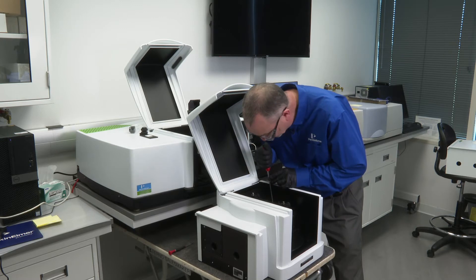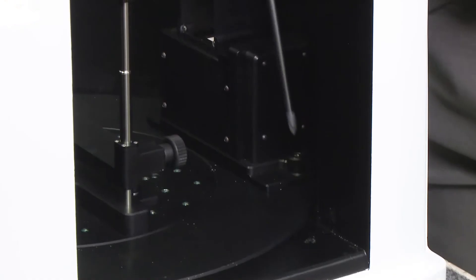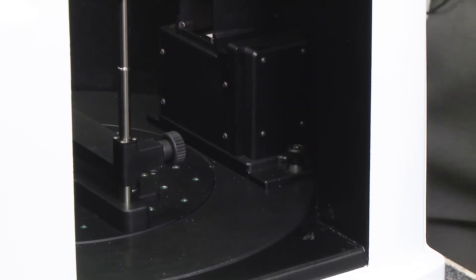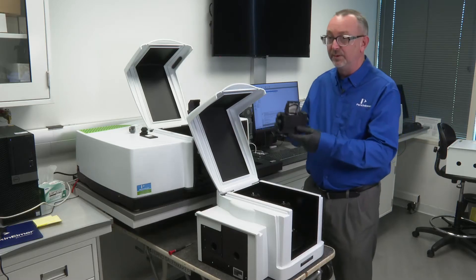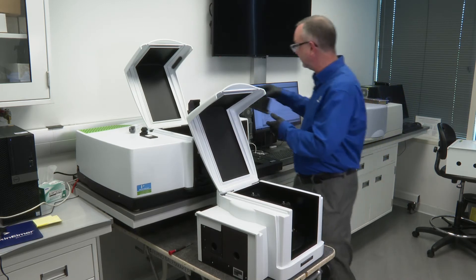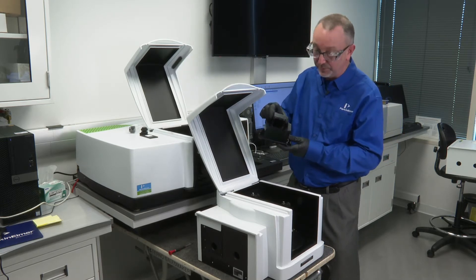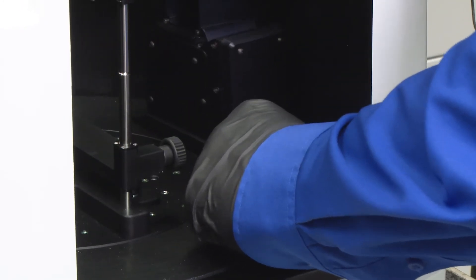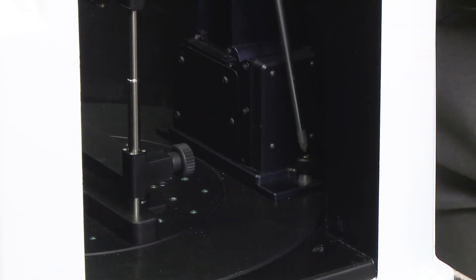The sample detector contains two screws. These are simply removed with the standard screwdriver that comes with the instrument. This one is the integrating sphere detector, and I'm going to replace it with what's called a direct detector — there's no integrating sphere in here. There's a guide pin; push down.